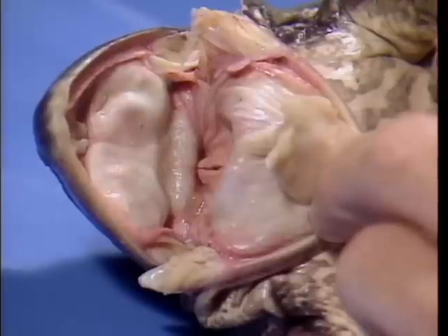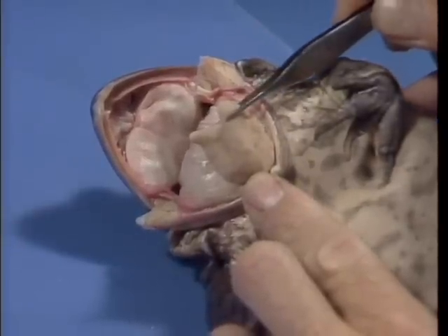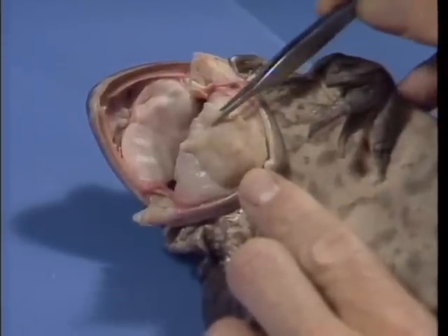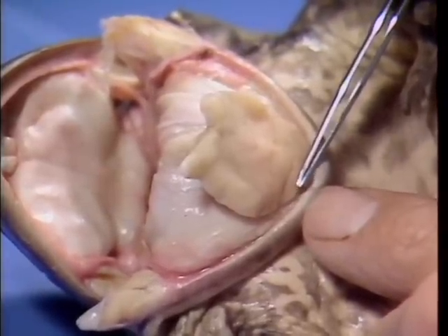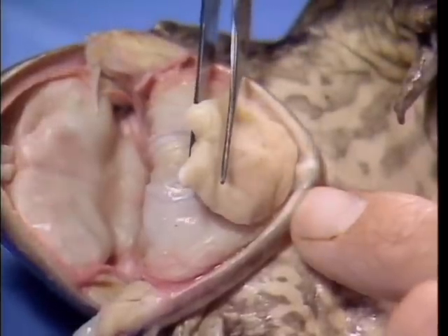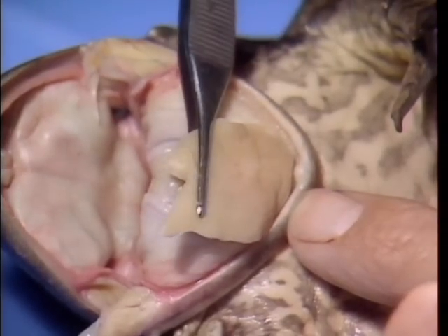Note the large fleshy tongue in the floor of the throat. If you grasp it at the free edge with forceps and lift it forward, you will see that it is attached at the anterior margin of the mouth cavity, unlike most other vertebrates. The tongue is hinged at the front and is quite sticky in live specimens. It can be quickly extended and retrieved to grab passing insects.